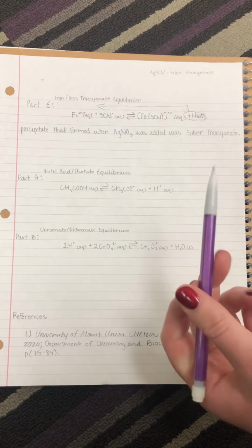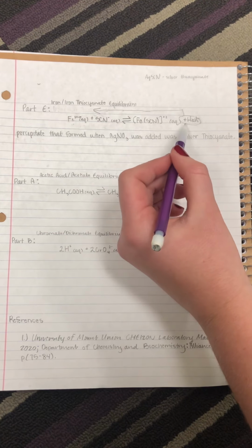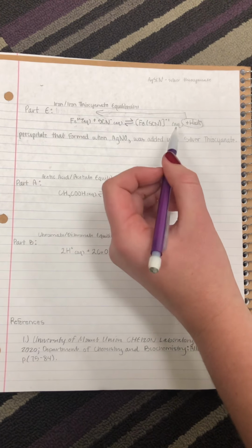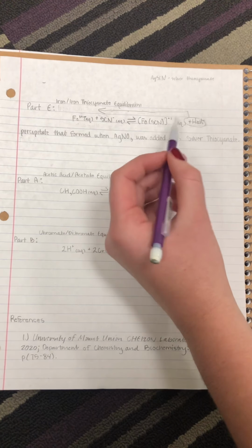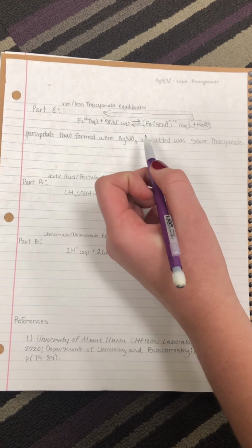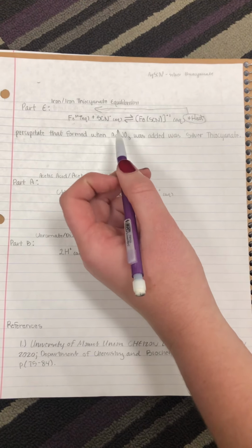For this part of the lab, there were a couple of different stresses placed on the equation. The first being heat. When heat was added, the solution turned to a lighter red coloration. We can infer that due to the change in the hue of the color, the equilibrium shifted to the left towards the reactant side. This product's clear coloration will lighten up the red color, giving the solution a more orangish red color.